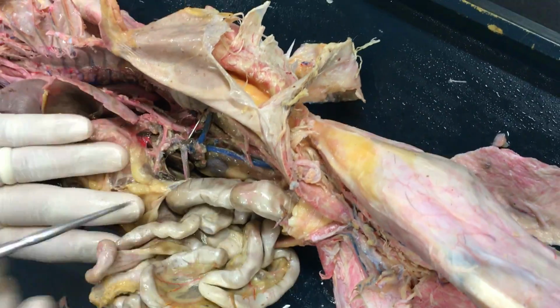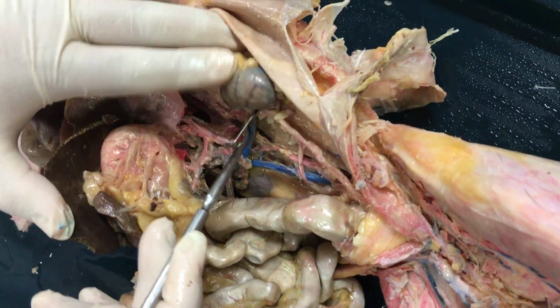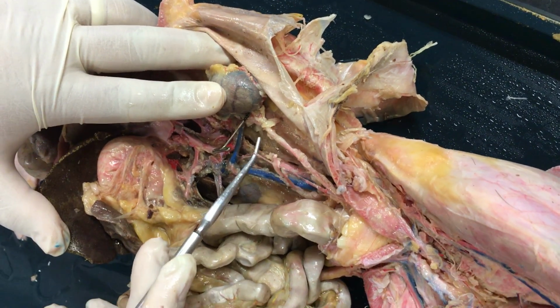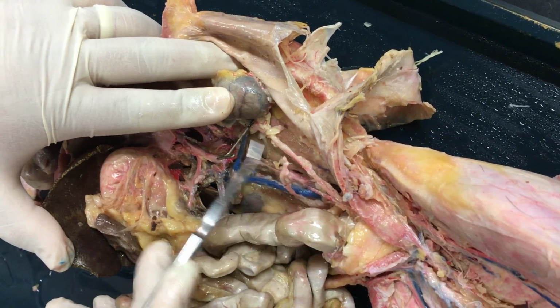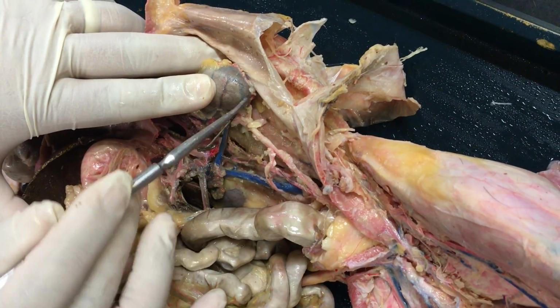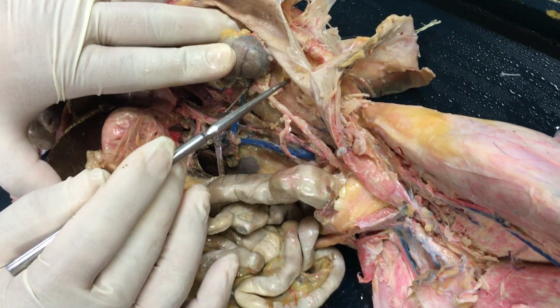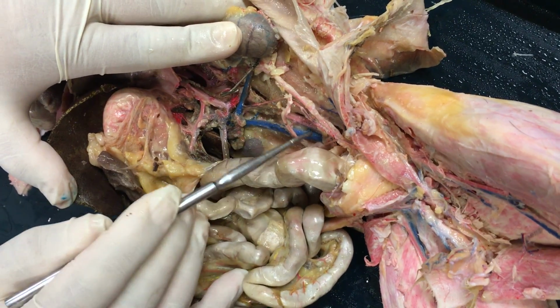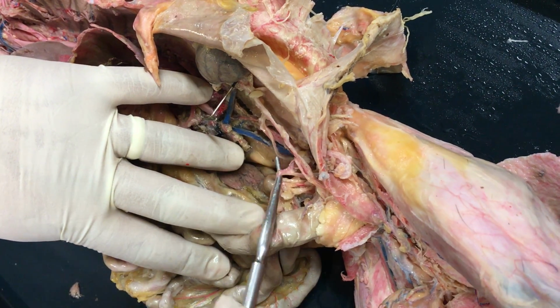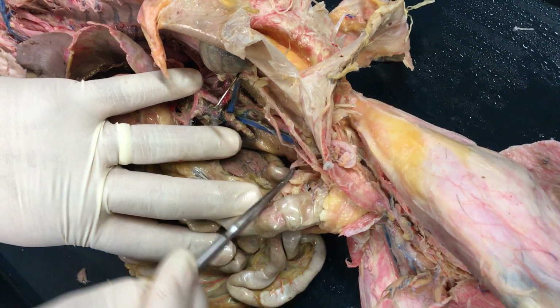Not visible there. Continuing on down, the next major branch that we want to consider is the renal artery that is supplying the kidneys. After that, you have your gonadal artery, in this case, spermatic or testicular artery, just making its way down to the testes. Remember, in a female cat, the ovaries would be here, just caudal to the kidneys, so that ovarian artery would then just move lateral. And so be aware of that. As you continue to move down, the next major branch is the inferior mesenteric, which is that guy there, which is supplying the descending colon and then the sigmoid colon.